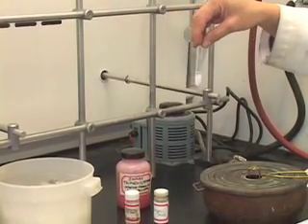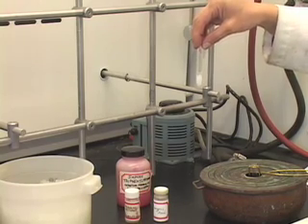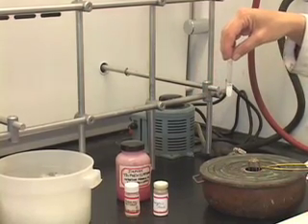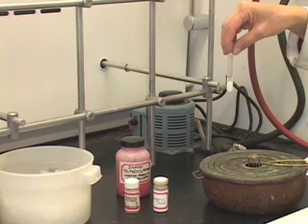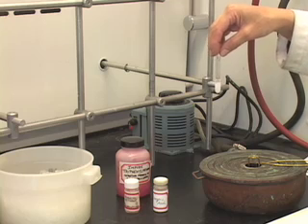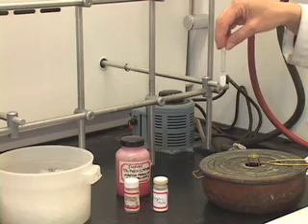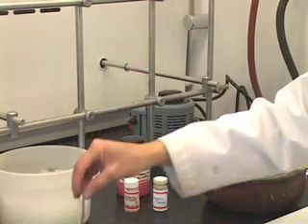That was the compound that I was testing. Of course, you will not be testing benzoic acid. You, as I mentioned, will be testing standard triphenyl methane, and you will probably come up with a different solvent or maybe the same solvent, I do not know. However, you are going to check, as I mentioned before, the choice of your solvent with an instructor before proceeding on to purifying impure triphenyl methane.